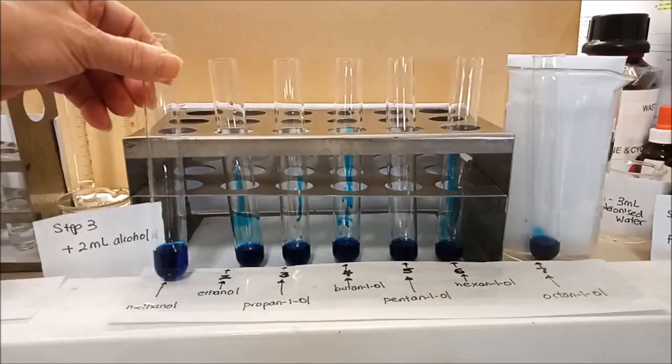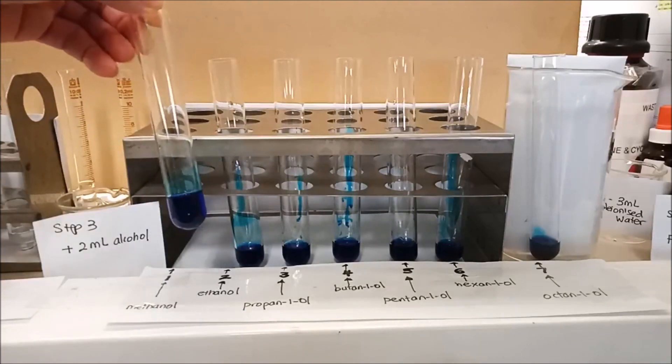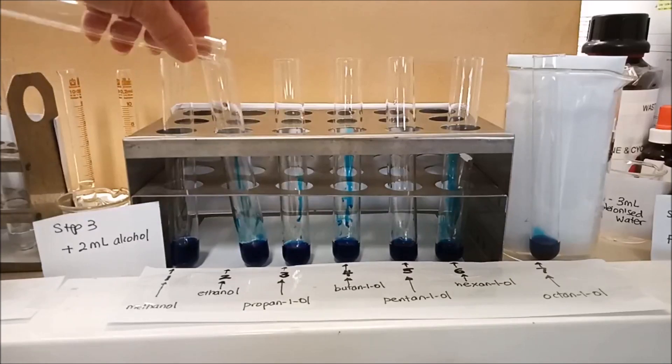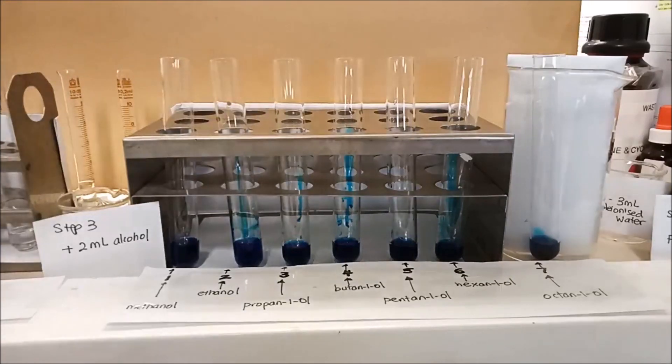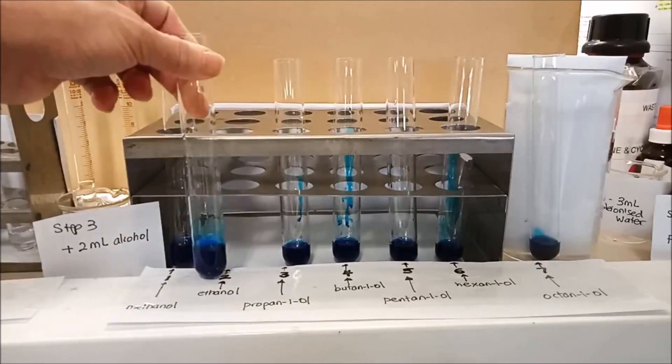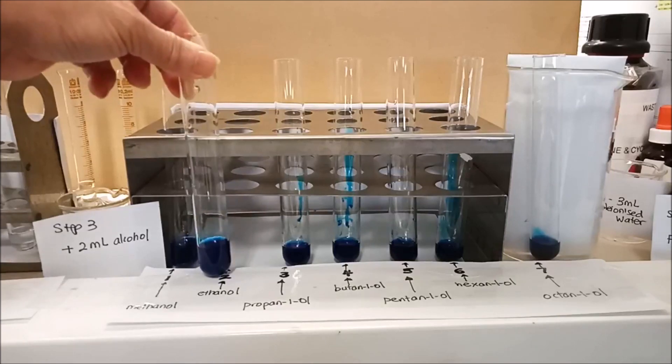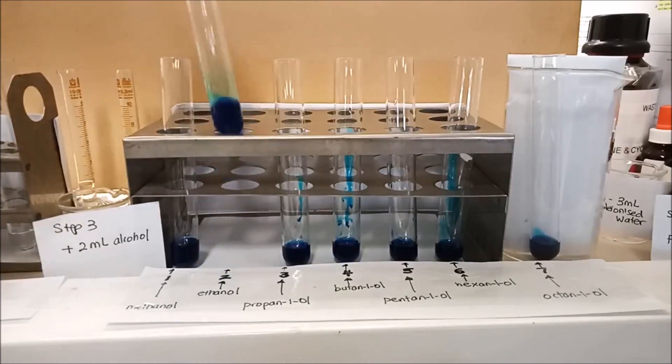Methanol is completely miscible. And it's completely miscible again. And there's no separation of these two liquids in two different layers. They all mix really well. We say this is miscible.